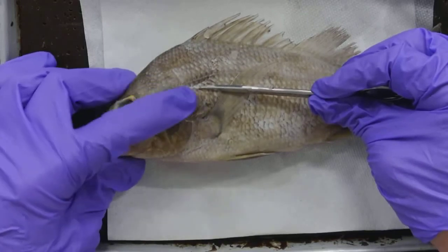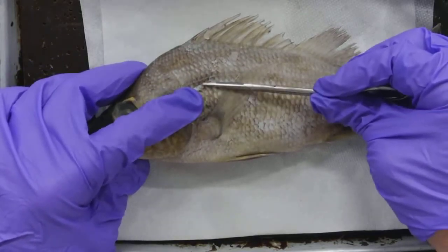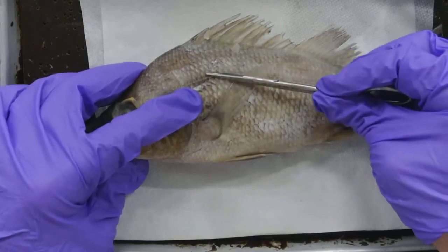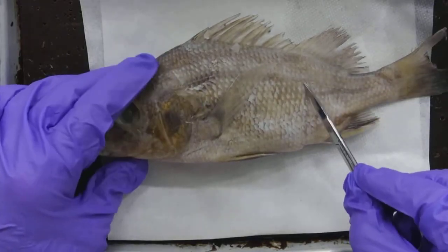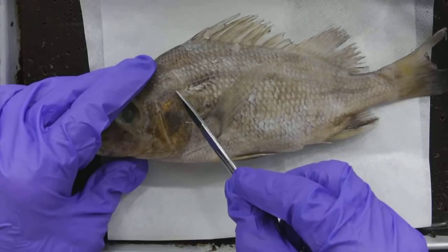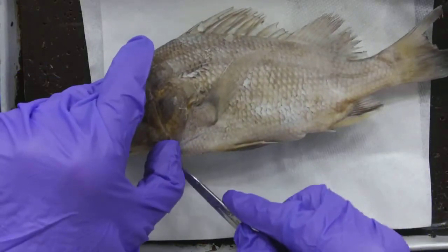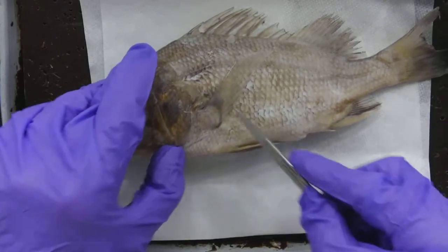Now if you've ever eaten fish, it's got a lot of muscle in it. But we don't want to cut into the muscle and we don't need to. It's tedious and we don't need to see that. So we're going to cut up to about here and I'm going to remove this whole segment of skin, but I'm not going to go too far up into the muscle.